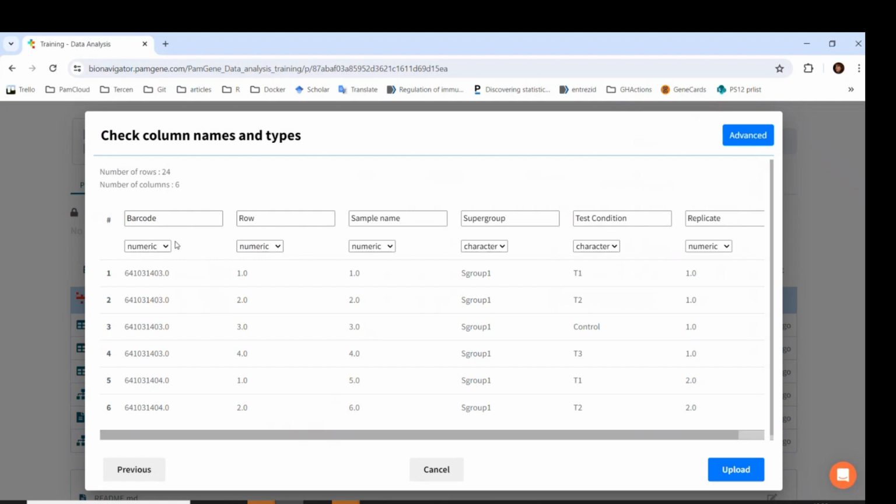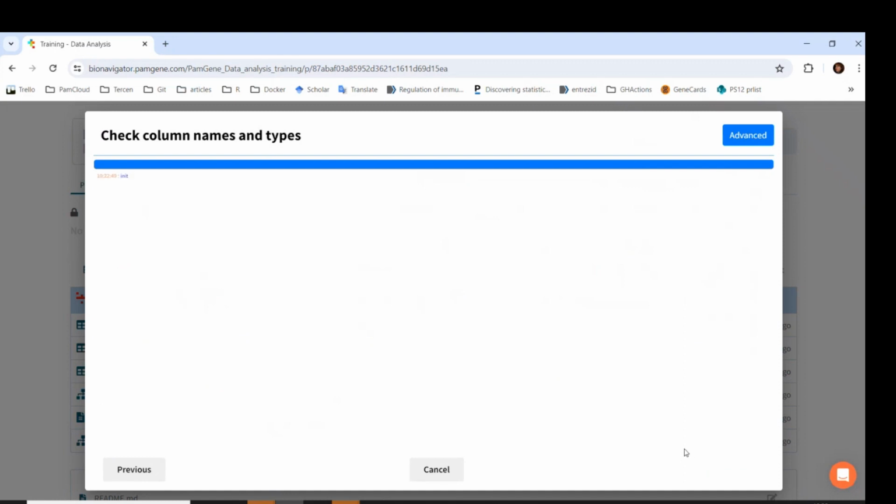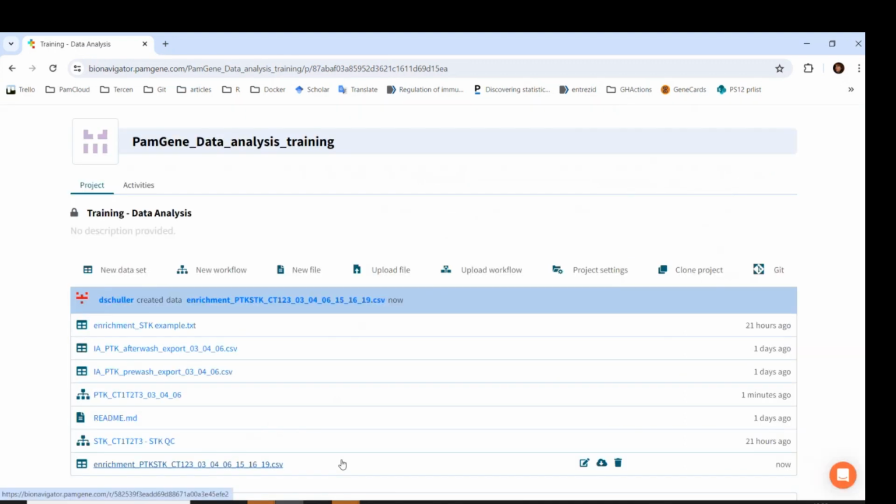Since image analysis outputs barcode as character and row as numeric, we have to make sure that these match with the sample annotation file, since the image analysis output and the sample annotation is joined together with these columns. So I will change the barcode to character. The other reason why we have to set the correct data types per column is because the Y factors in the crosstab view have to be of numeric type. They cannot be characters. Therefore, it is also good to not have any additional numeric types, which should be characters. Let's upload this and go back to the workflow.